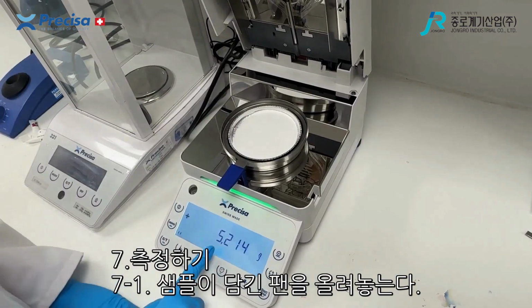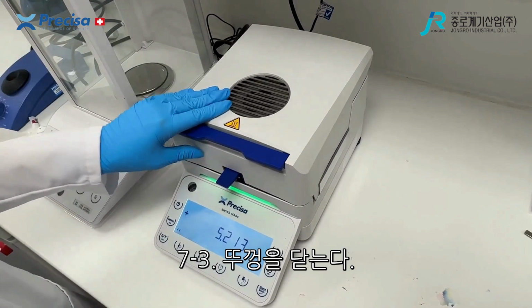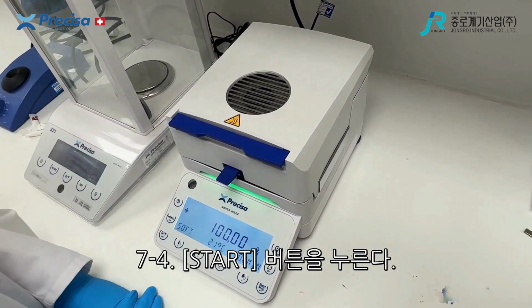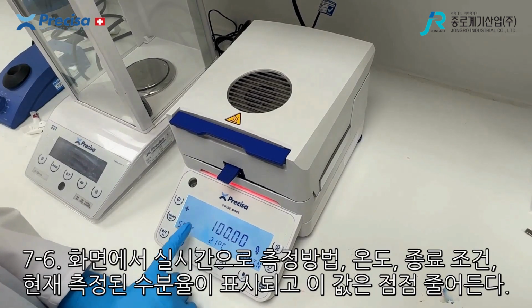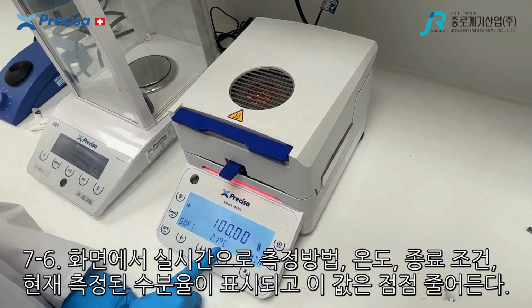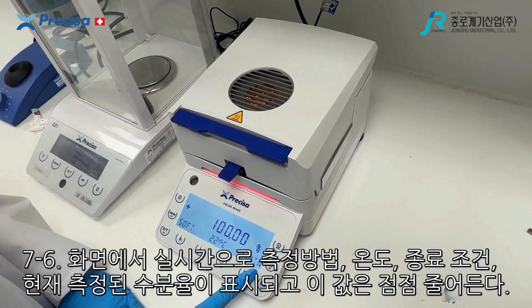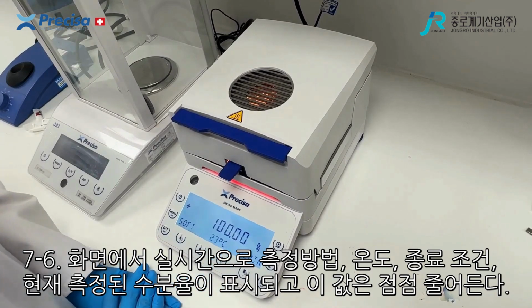Now that you've loaded your sample, you can see the weight of it here. Once you're ready, you close the lid and you press start. You can see now that it's turned red, and this shows you that the sample is running. And you can see your heating parameters here. So it's soft heating, this is the temperature it's currently at, this is the stop parameters, and this is the percentage moisture, and this will go down once the moisture loss has begun.